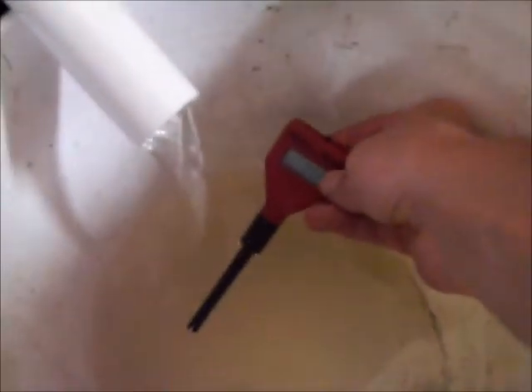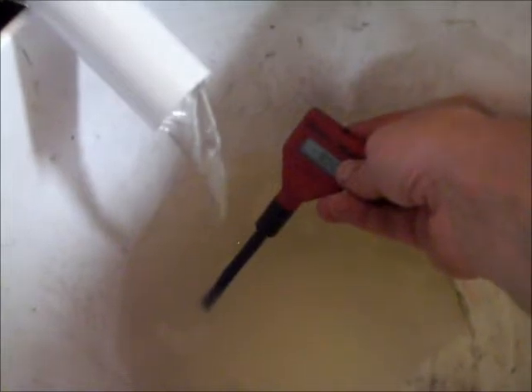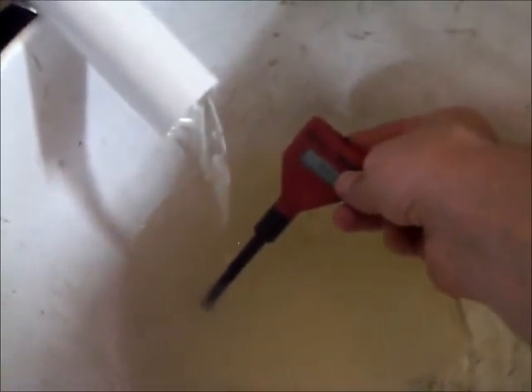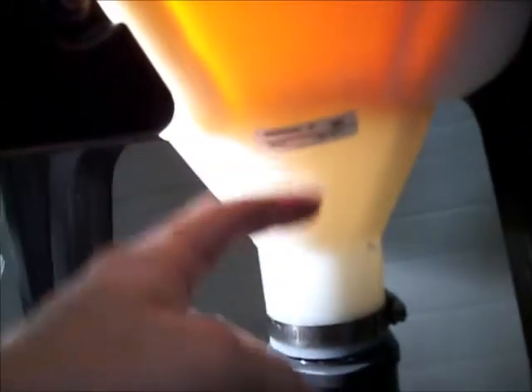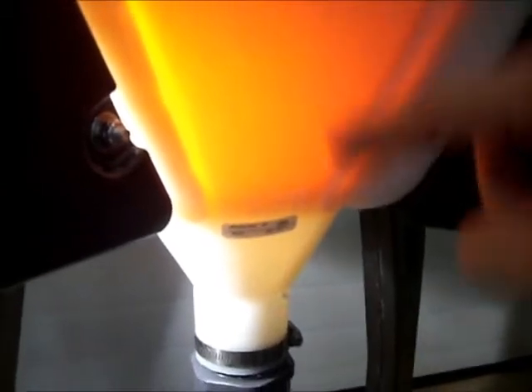There's not a lot of impurities in the salt wash water. I don't know how the salt affects the pH reading — it probably increases it. You can see moisture just dropping out of the biodiesel and filling up the bottom. There's still tons of water dropping out even though I've taken the bubbler out of the bottom and moved it up higher. It's still dropping water out.